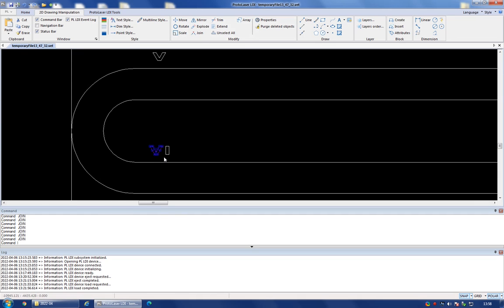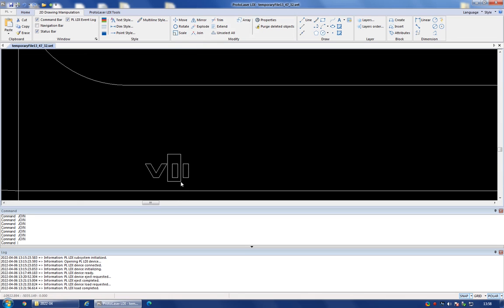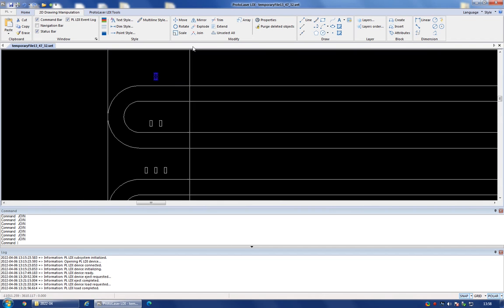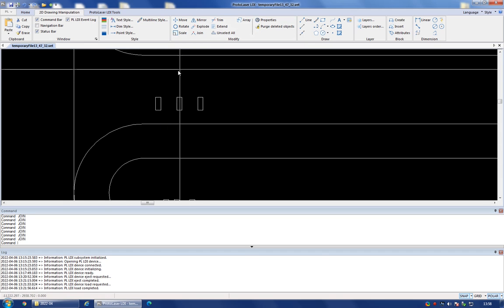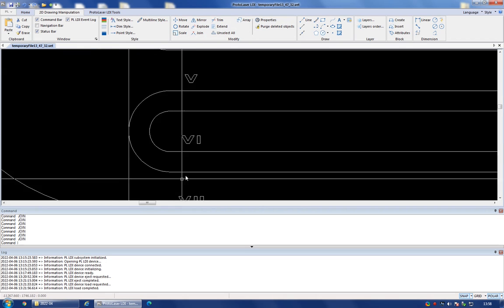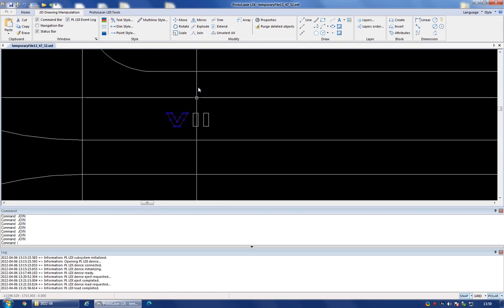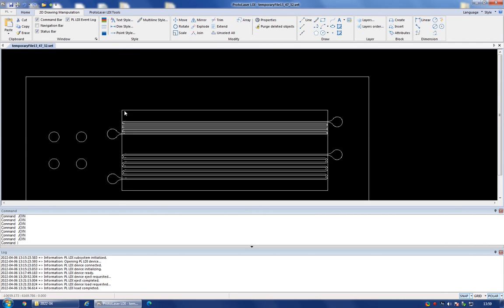Okay, join. And this is the last one, and I'm going to do the same thing on the one on top. It's always a good idea to select it and check that you've joined it correctly. Now, just in the interest of time, I'm just going to trust that I'm doing it correctly. Join all of these. Hit the join button. There we go. There. So now all these shapes are joined, and they are ready to set the attributes.